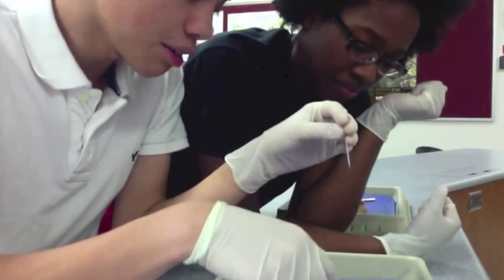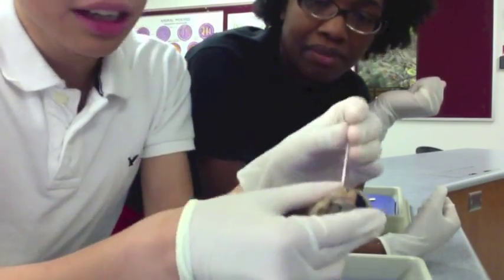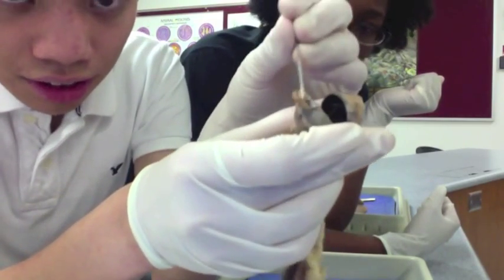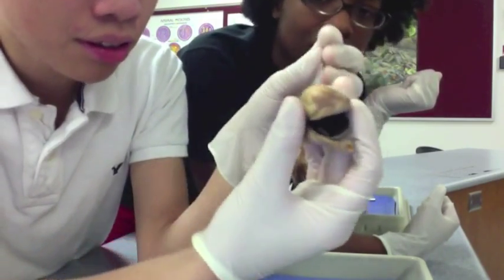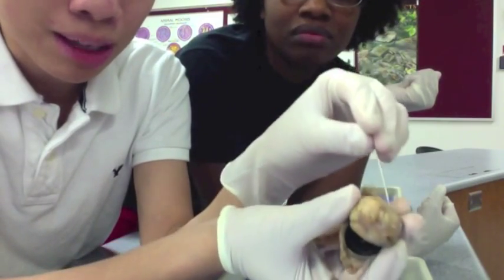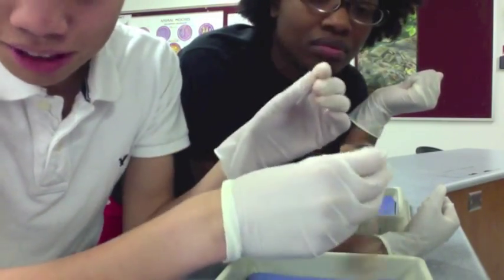Extrinsic muscles — those are the muscles that you see that kind of just go off right here. They're little muscles, almost like around the back side of your eye. So those are extrinsic muscles.